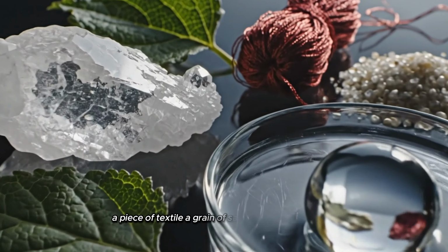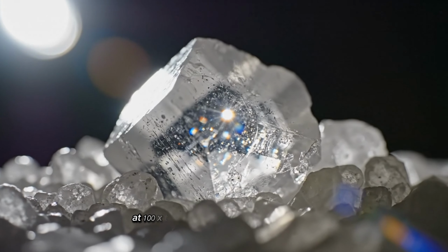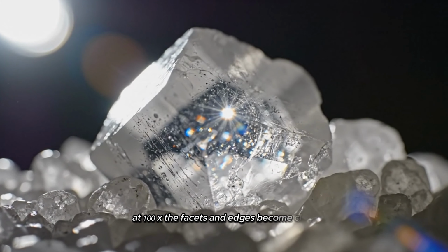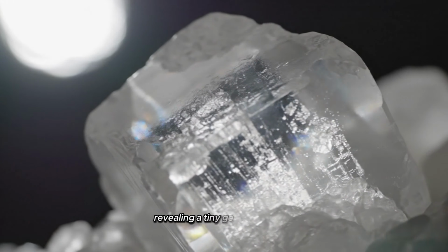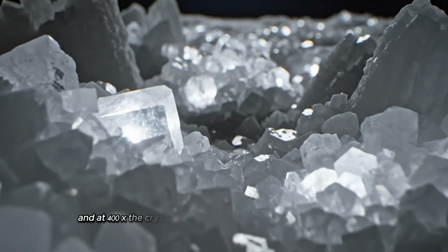Let's start with a simple salt crystal. Under the 10x lens, we can see its basic shape and structure. At 100x, the facets and edges become clear, revealing a tiny geometric world. And at 400x, the crystal transforms into an abstract frozen landscape glowing with intricate detail.